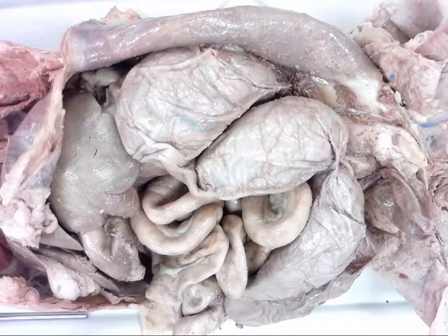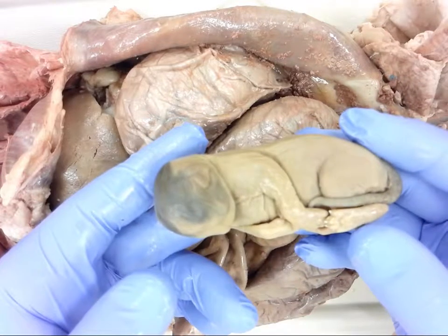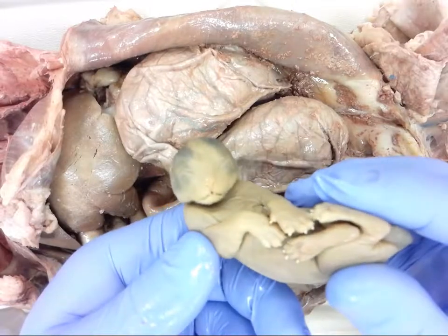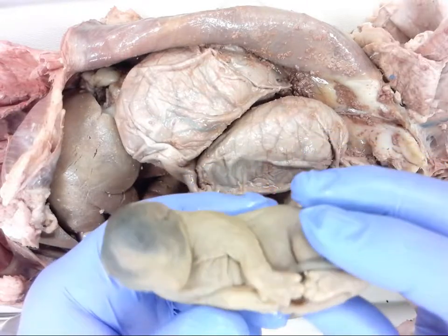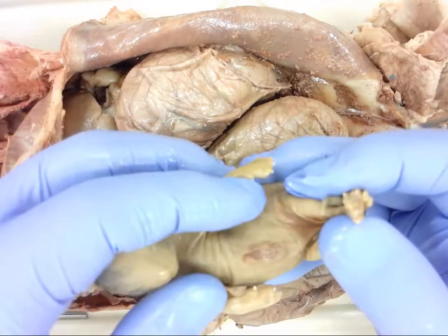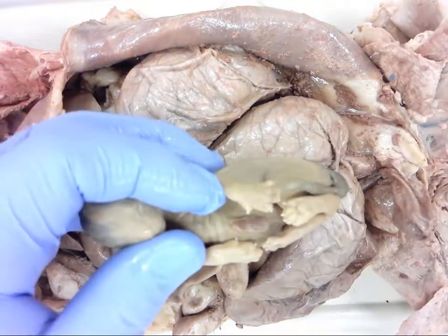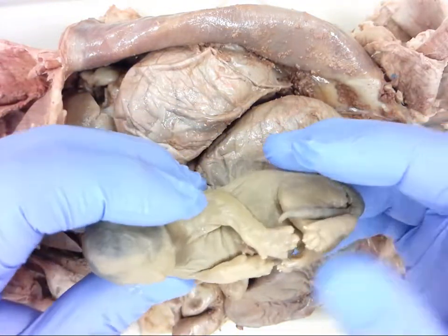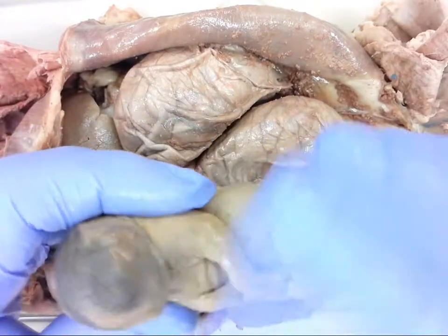I do have some previously dissected specimens to show you. If you're not interested in seeing kittens you're welcome to turn the video off, but just to give you an idea from a developmental standpoint. This one is probably somewhere closer to being born - you can see some features reminiscent of what you would see when it's born: eyes and nose, eyes are closed, you can see the tongue just a little bit, paws, claws, and the tail. Ribs are also being developed. If we move the paws out of the way you can see on the belly is the umbilical cord.